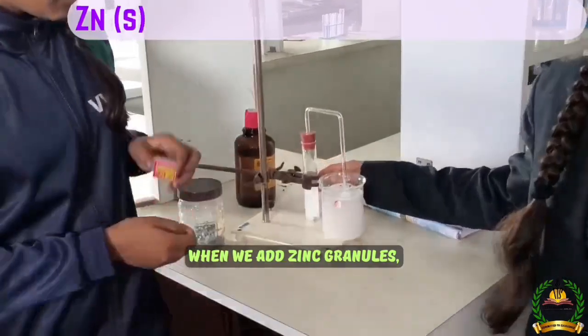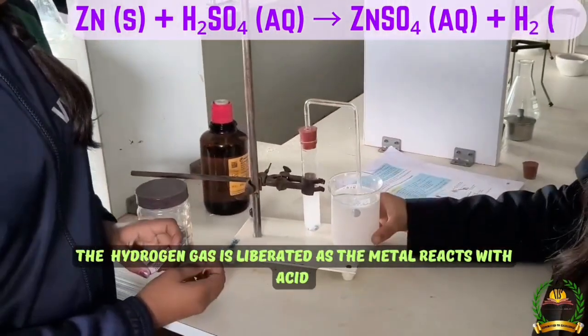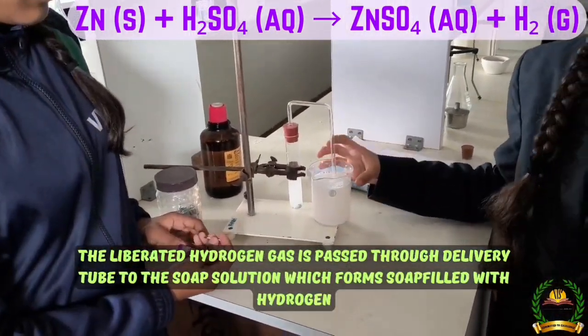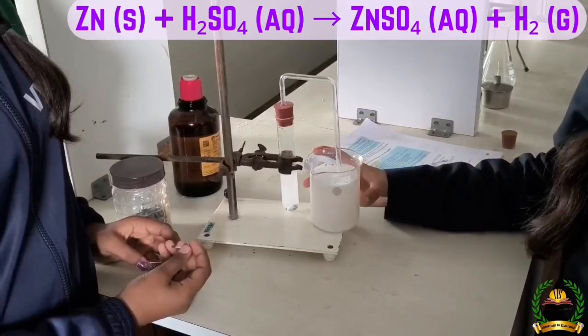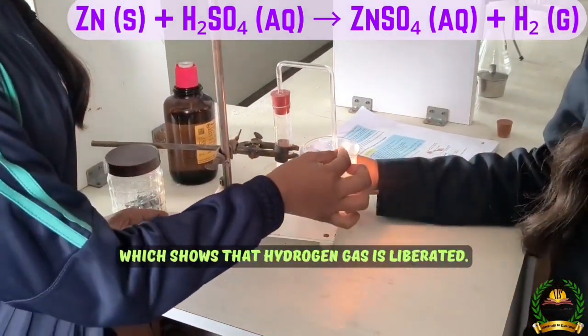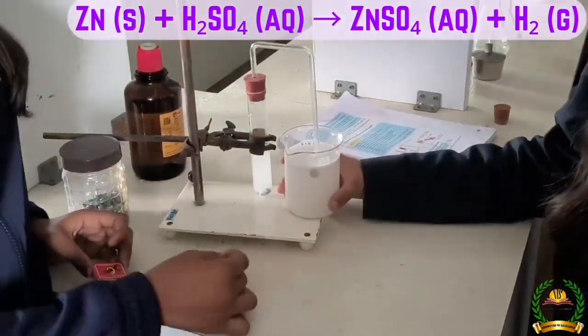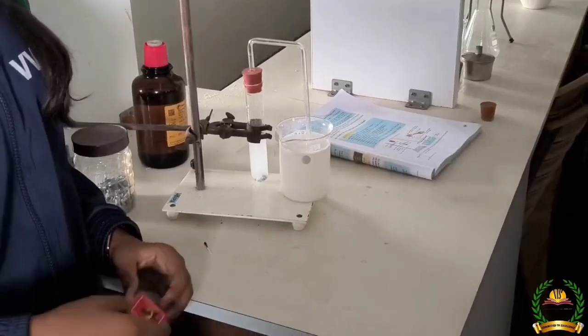When we add zinc granules to the solution of dilute sulfuric acid, hydrogen gas is liberated as the metal reacts with the acid. The liberated hydrogen gas is passed through a delivery tube to the soap solution, which forms soap-filled hydrogen bubbles. When we take a matchstick towards the bubble, the hydrogen gas burns with a pop sound, which shows that hydrogen gas is liberated.